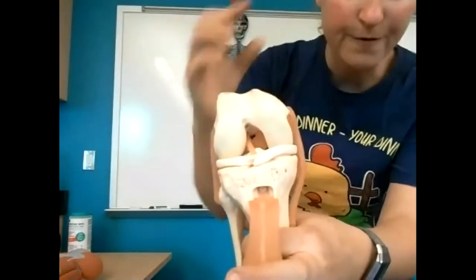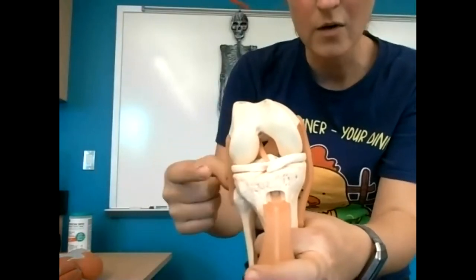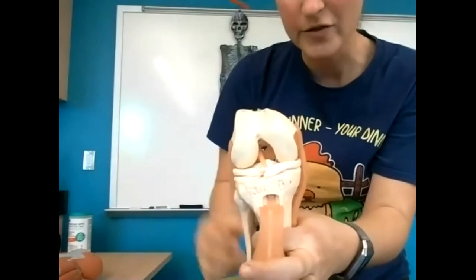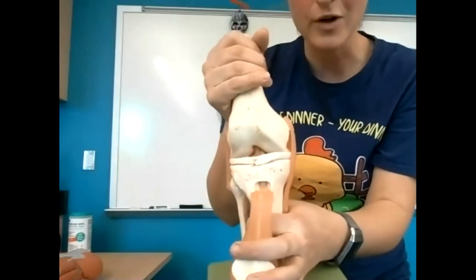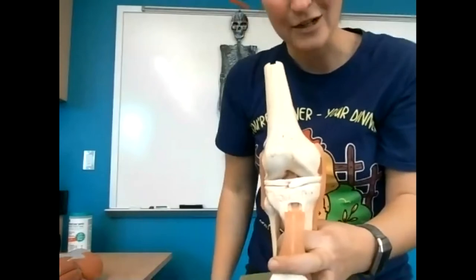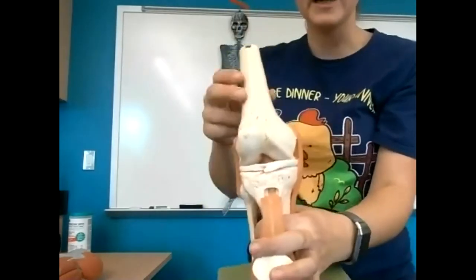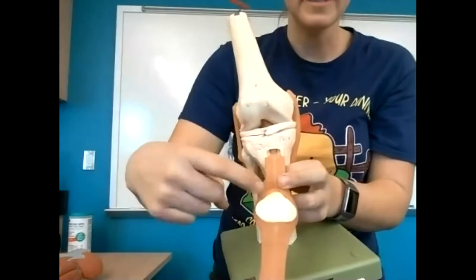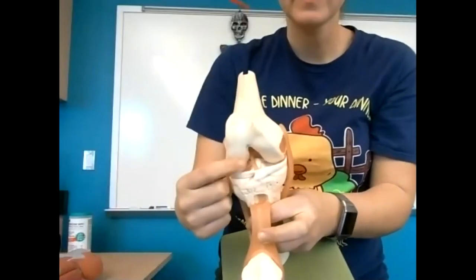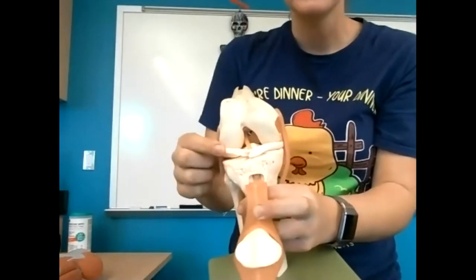You'll also see these little fibrocartilage discs, similar to the discs in your spine. These are called menisci — two fibrocartilage cushions — so that when you're doing jumping jacks or jogging, your femur isn't grinding down on your tibia. The patella is embedded within connective tissue on the chicken as well. When you cut through part of the knee, you'll see a strappy, shiny, white cruciate ligament and these little flappy discs — a meniscus.